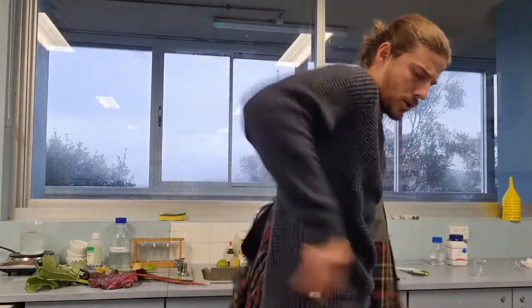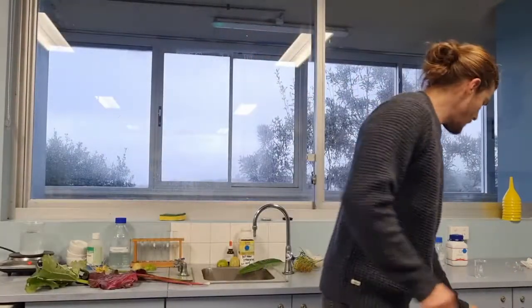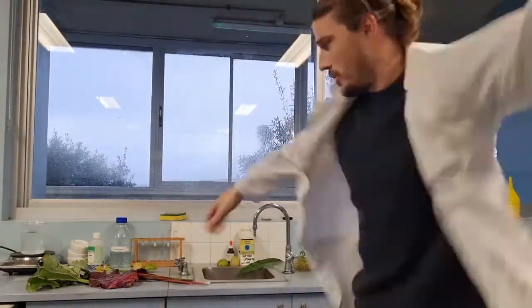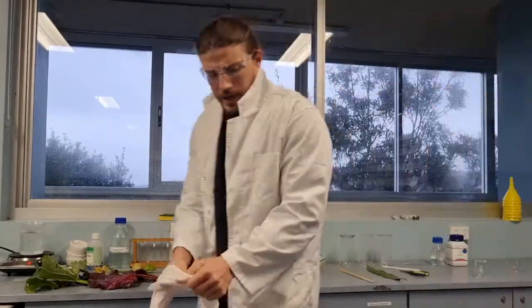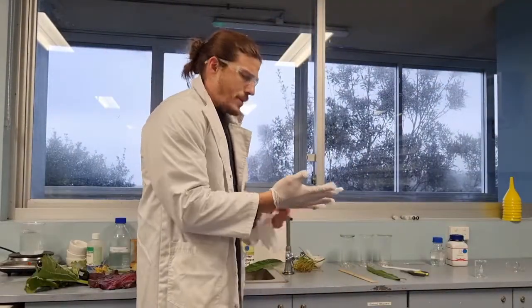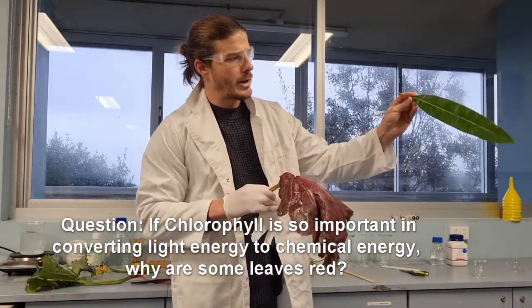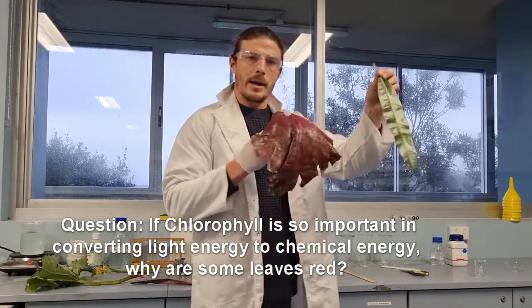I'll quickly go through what we've got and what we're going to look at. To do that though, I'll chuck on my safety glasses. This tests chlorophyll content and other pigments in a green leaf. This is from the mango tree that I took earlier, and here's a bit of spinach, obviously very different colours.